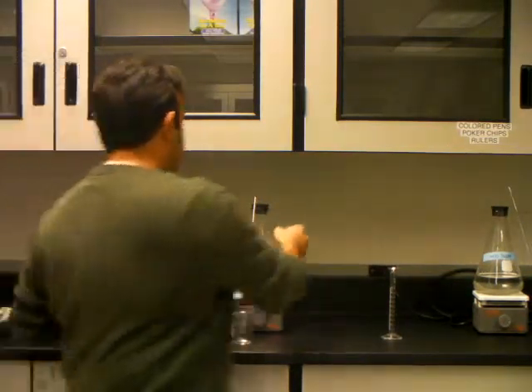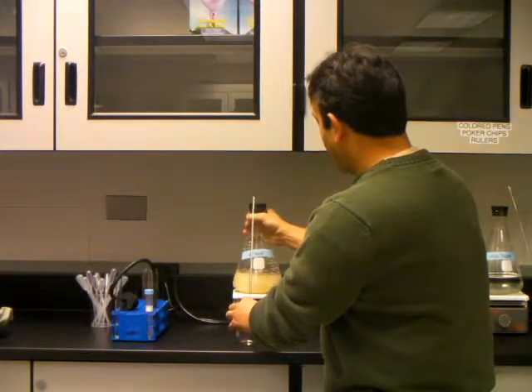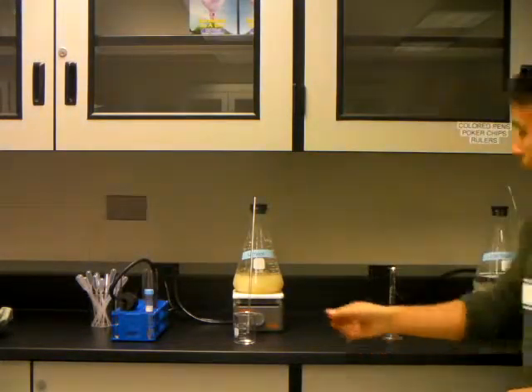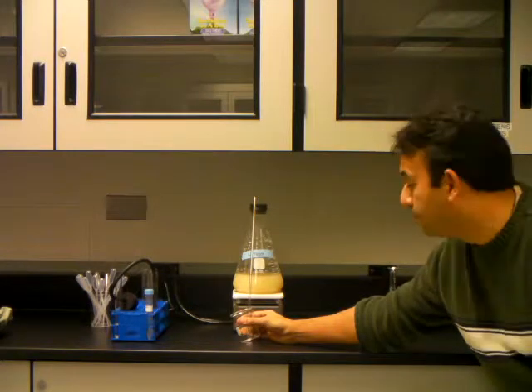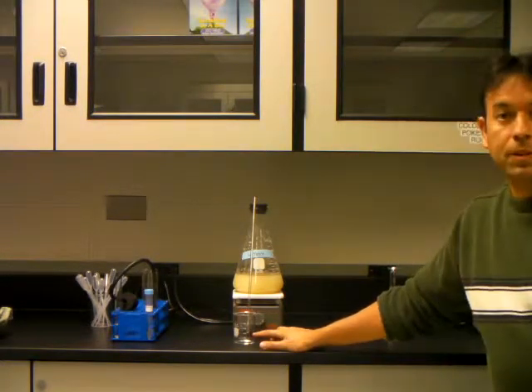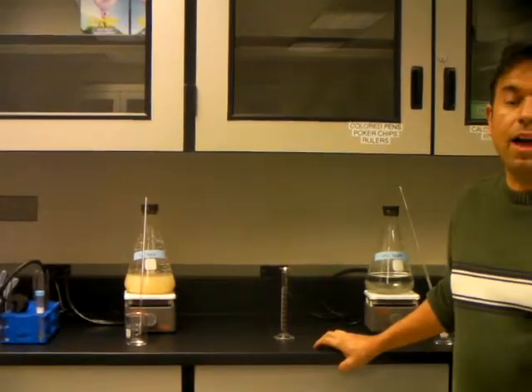What's going to happen is the yeast with the corn syrup and the water will start to create alcohol, and that liquid will eventually start to come out into this beaker. And what you will be doing is collecting the liquid that's here and the liquid that's here and testing it for alcohol production.